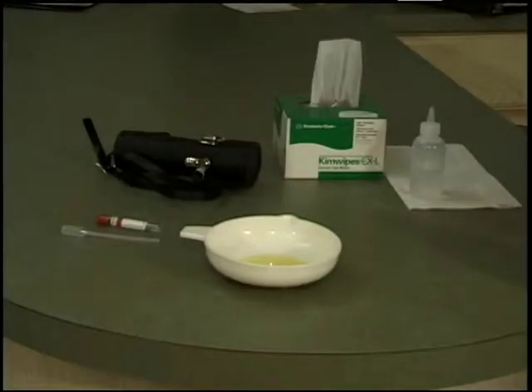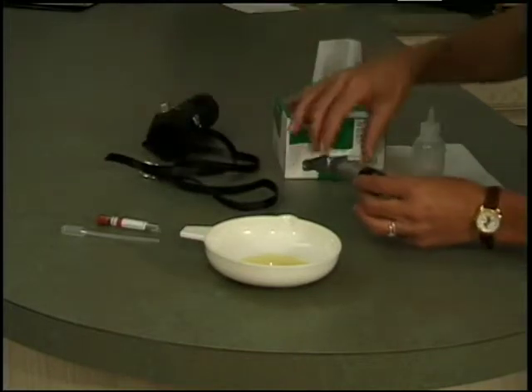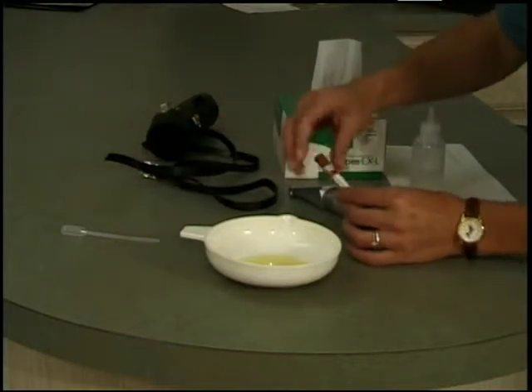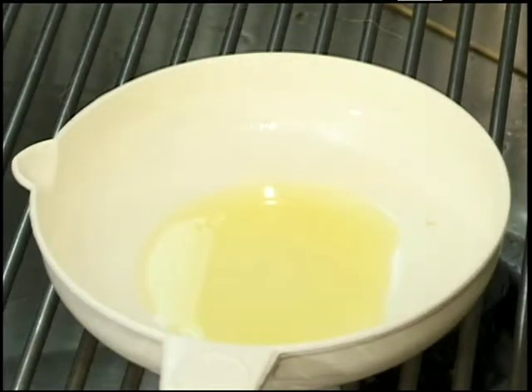A refractometer is an instrument used to measure specific gravity or protein concentrations in various fluid samples. A specific gravity is a measurement of the density of a fluid as compared to distilled water. This is often an important piece of diagnostic information when evaluating a urine sample.